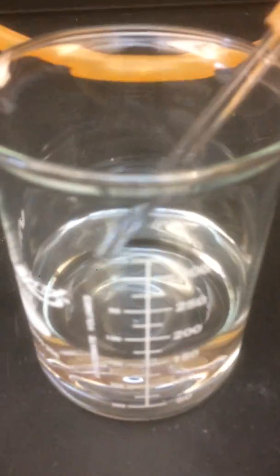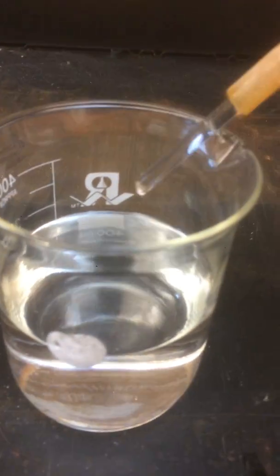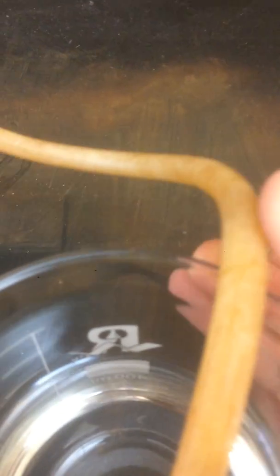And let's check this one. All right, that looks like it's done, I think. Let's see. Yeah, I'm going to call that done. Let's see if this one's done. Yep, I think that's done too. Okay, so it's a little tricky one-handed, but I'm going to put a pinch clamp on here. There we go.